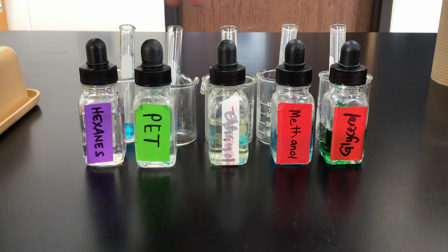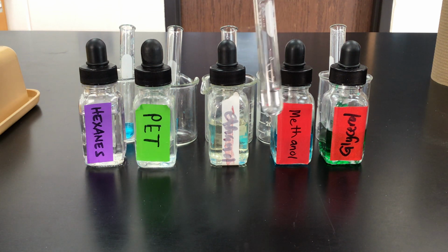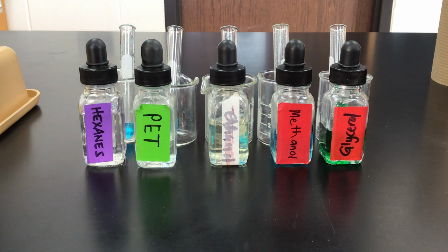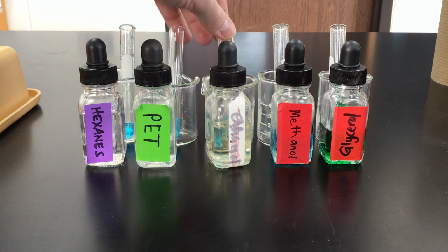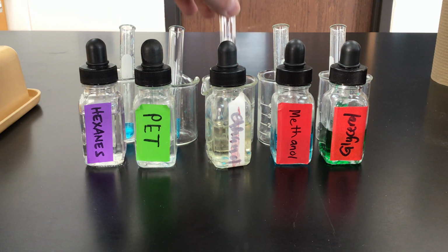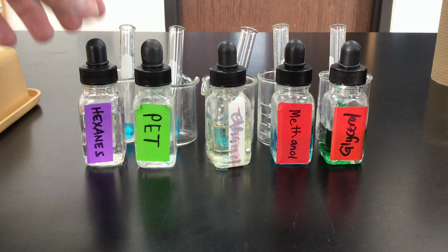And then in these test tubes behind here, I've already added a little bit of water to each. Now some of these liquids like the glycerin, the methanol, we added a color to them so it'd be easier to see if those solutions mixed. For the other ones that were colorless like the ethanol, I added a little bit of color to the water that's in here. So this is just water with some blue food coloring in it. All right. So what we're going to do is take these and mix them together.